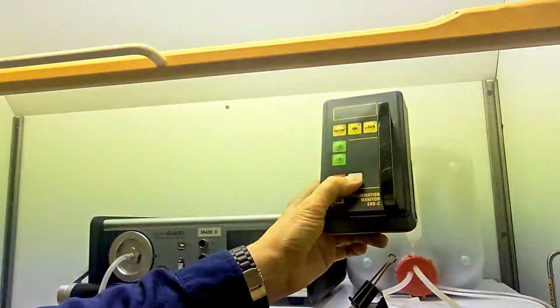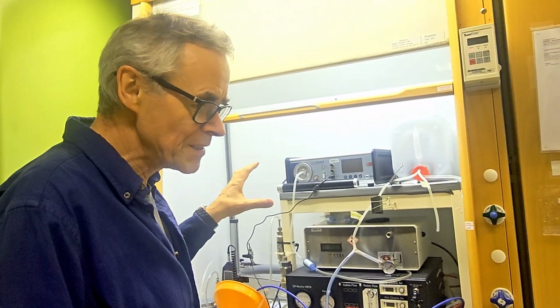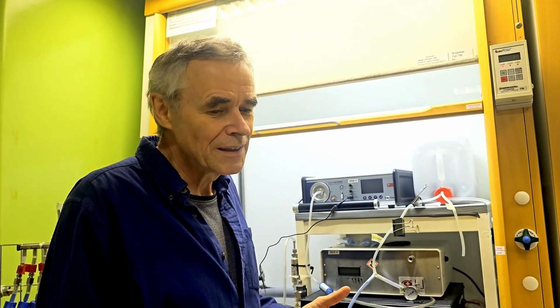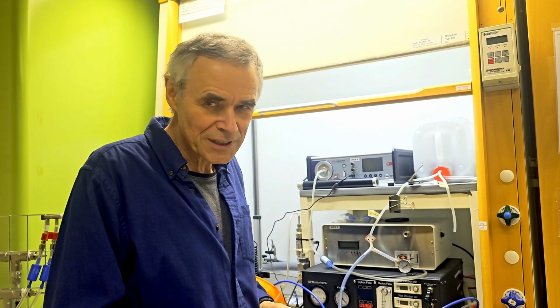Alright, I will turn it off, and I also want to introduce to you the whole facility. Because what is this facility? We are using the facility for the RadoNorm project to study the impact of radon in connection with cigarette smoke on cancer-related changes in lung epithelial cells.